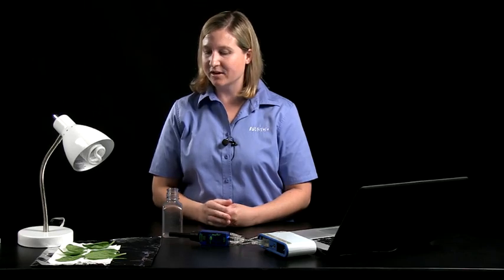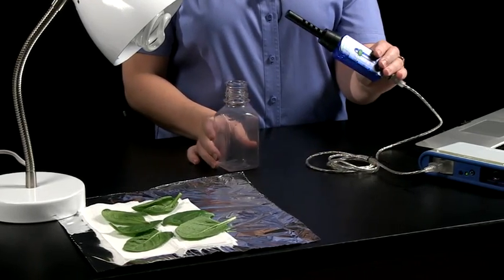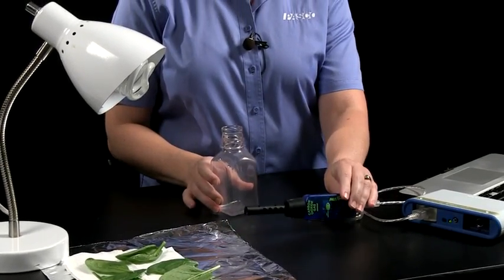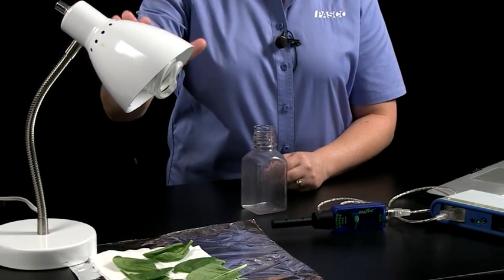The materials are very simple for the lab. We're going to use spinach that was just purchased at the grocery store, a carbon dioxide sensor in the sampling bottle that came along with it, some foil, and a lamp.